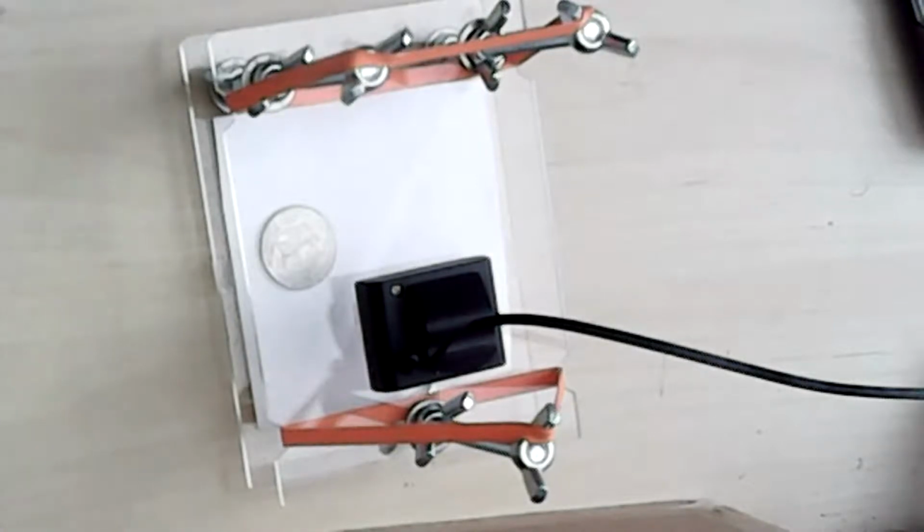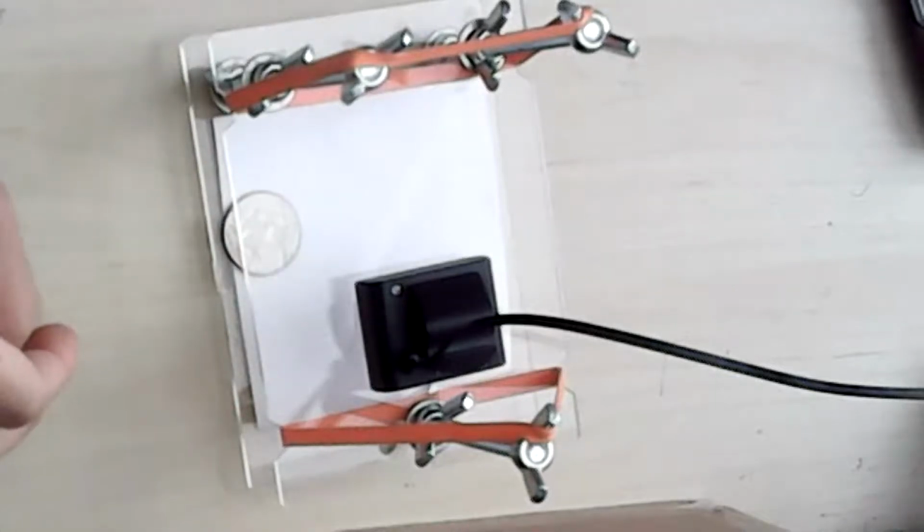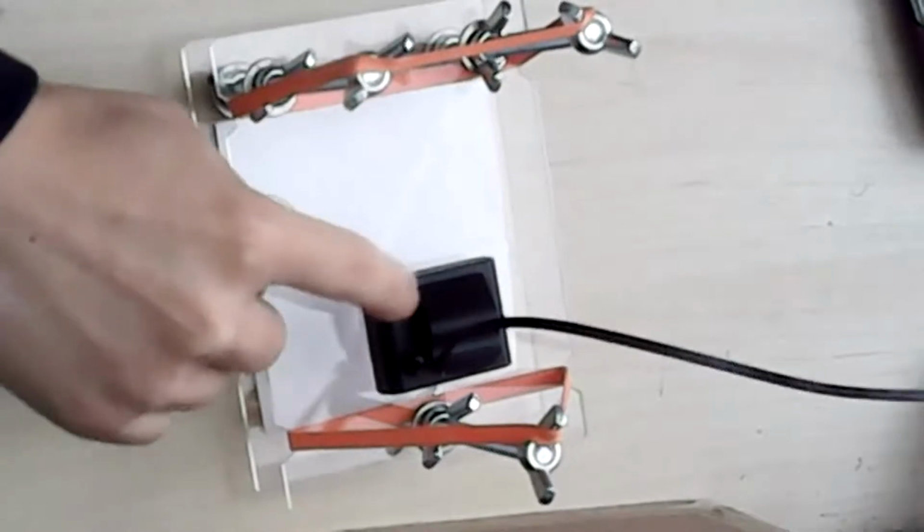I have a quick question. I think I missed maybe just one little bit. Can you repeat, Vanya, what you had the eye drops for? Was that just to help? Oh, like when you were. So I just wanted something with small font to focus the camera a little bit.